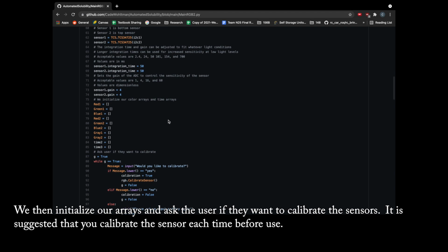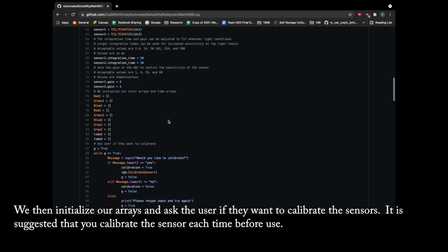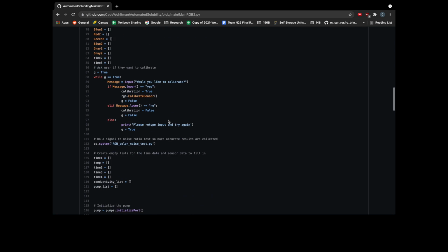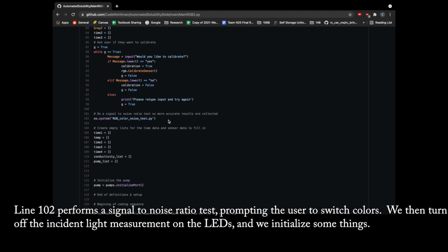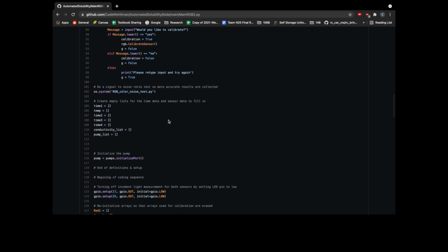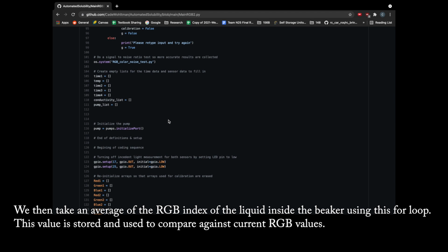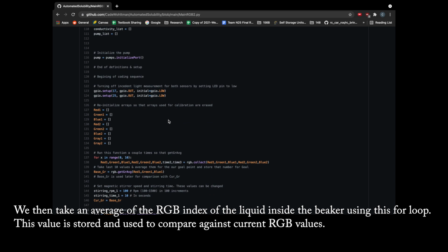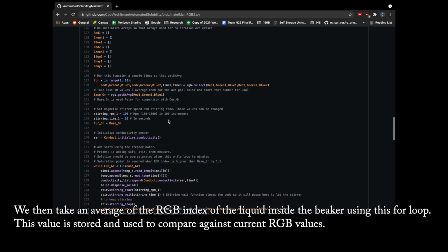We then initialize our arrays and ask the user if they want to calibrate the sensors. It's suggested that you calibrate the sensor each time before use. Line 102 performs a signal-to-noise ratio test, prompting the user to switch colors. We then turn off the incident light measurement on the LEDs and reinitialize some things. We then take an average of the RGB index of the liquid inside the beaker using this for loop. This value is stored and used to compare against current RGB values.